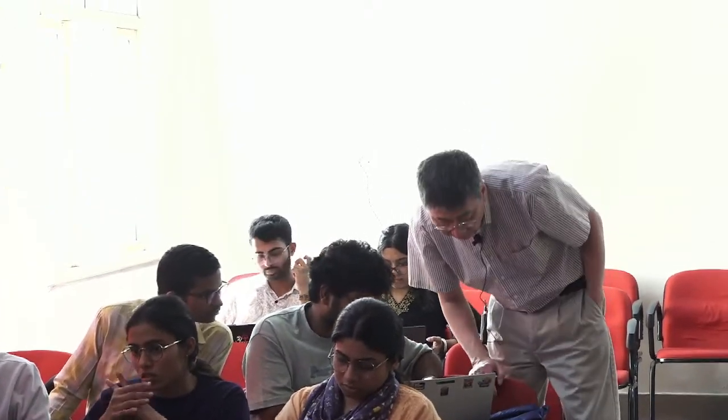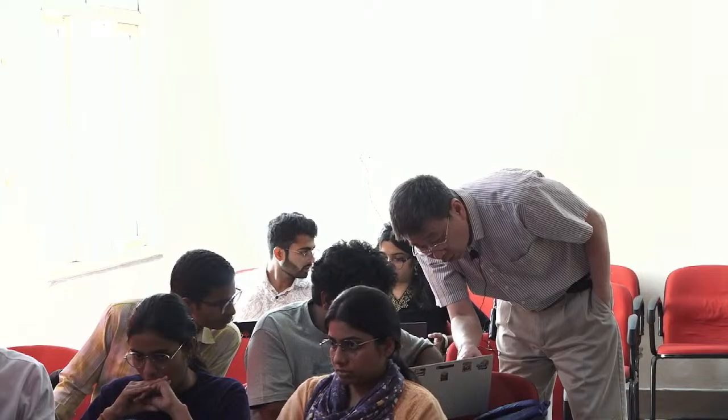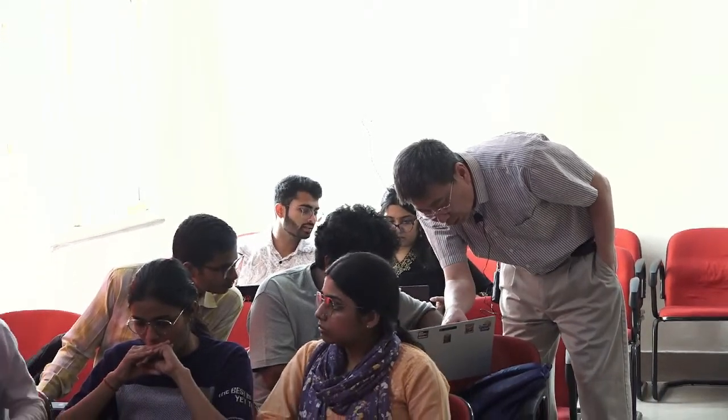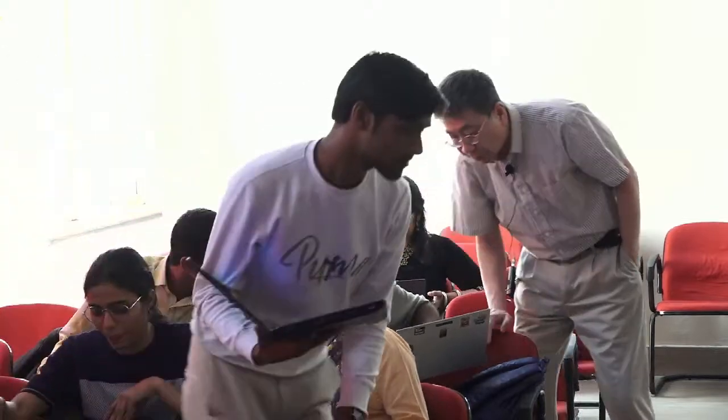I see. Which version of Coot is this? 0.9 something? Yes, sir, 0.9.8. Okay. Oh, do you still have a water there? No, I removed that. No, there's a water right there. See? Yes, sir. Yeah, that needs to be removed.